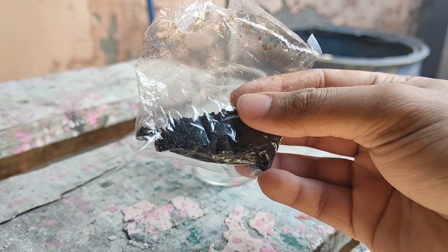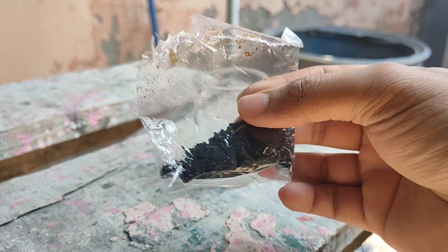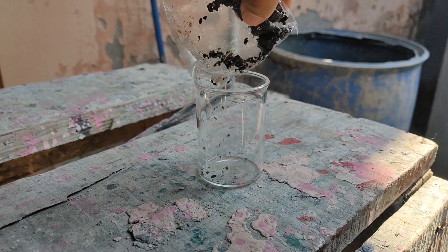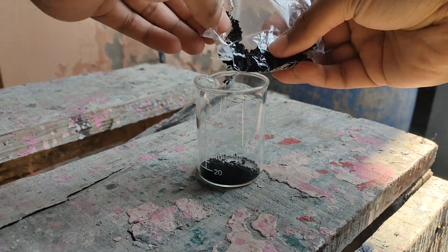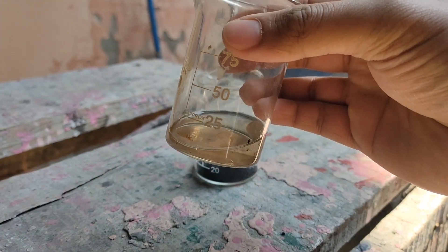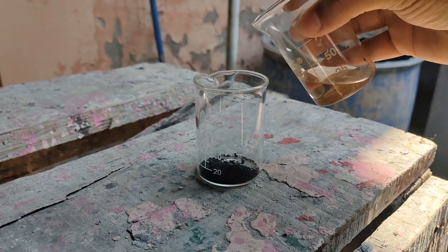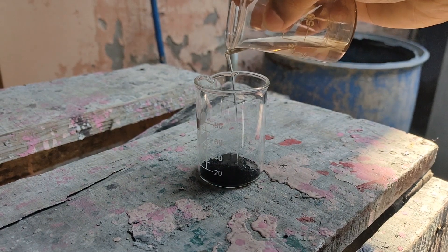At first we'll take a small amount of potassium permanganate and pour it into a beaker. Then we'll take some concentrated sulfuric acid and mix it with the potassium permanganate.